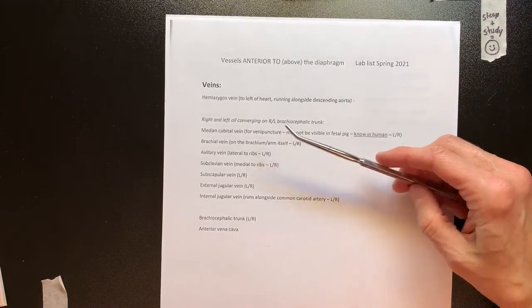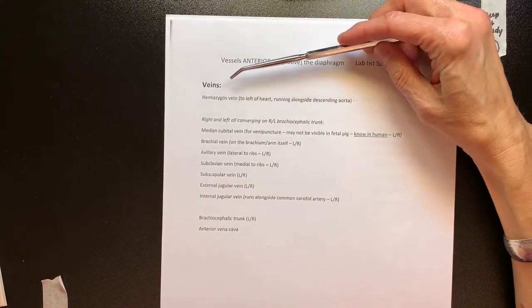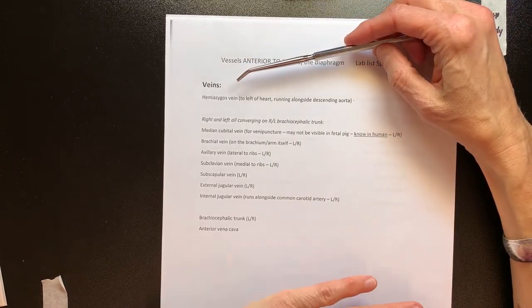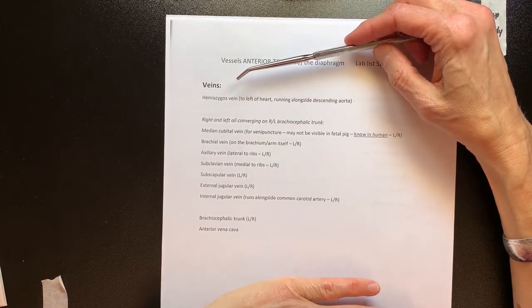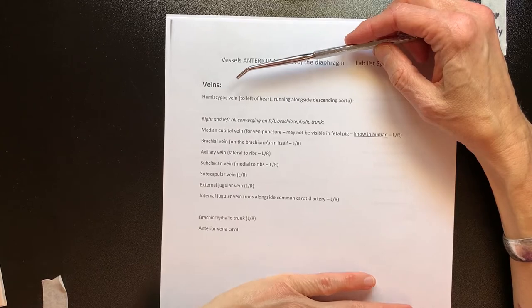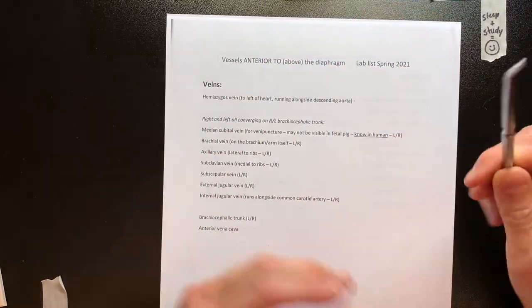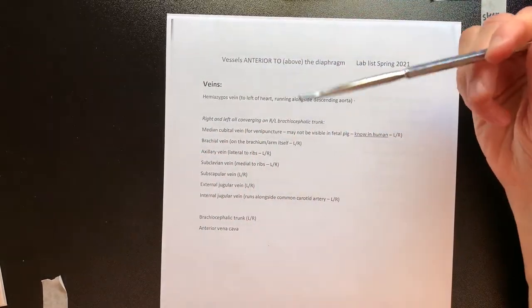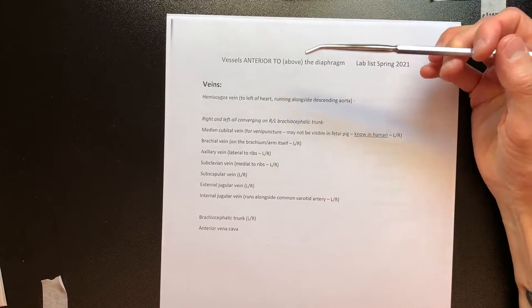Let's look at veins first, because veins will appear to be most visible when you first open the pig to look in. They'll be towards the surface or on top.